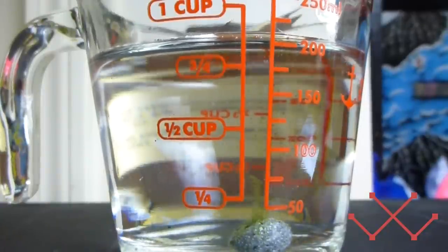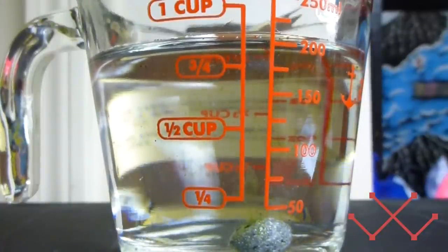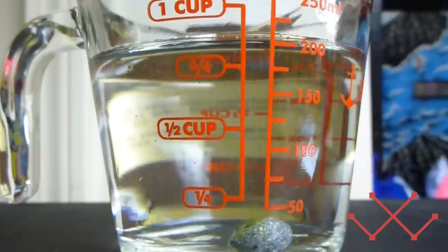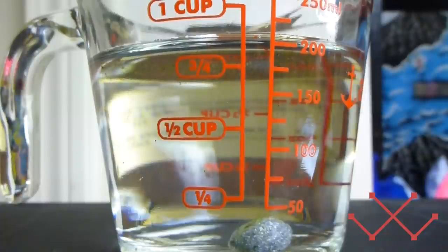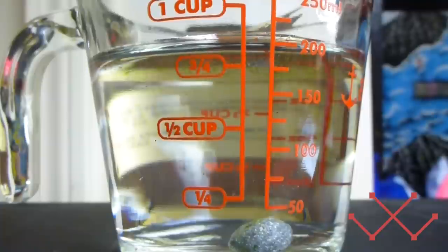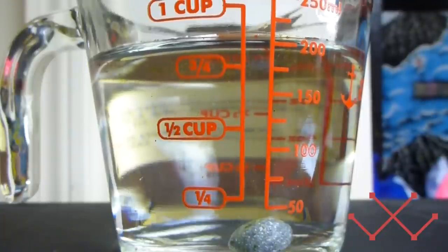Let me start by just taking this metal and plopping it in. Now, as you can see, it's instantly reacting. The metal starts bubbling and the surface turns yellow. Well, the surface turned yellow a little bit already because of some impurities that were left from my last experiment, but it doesn't matter. It just adds to the solution that's going to be made.